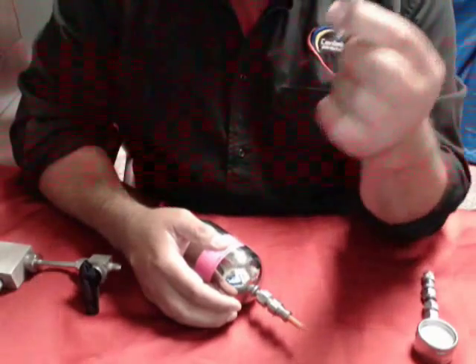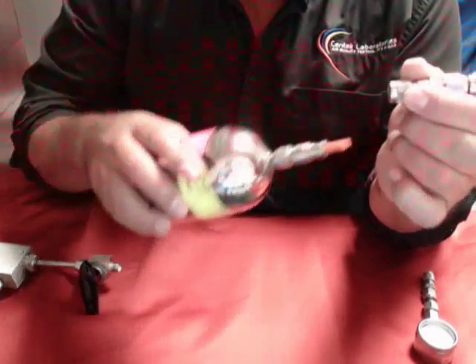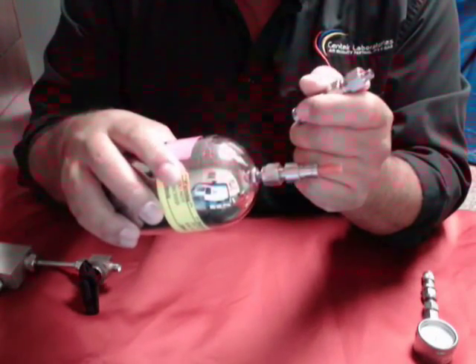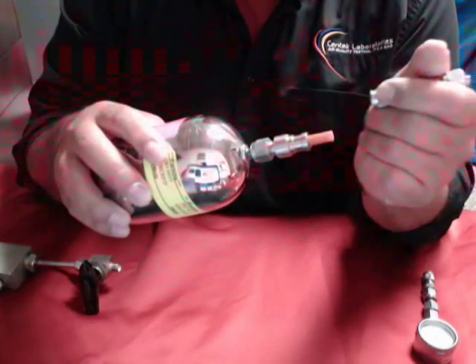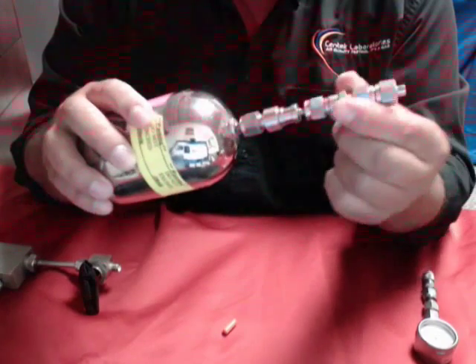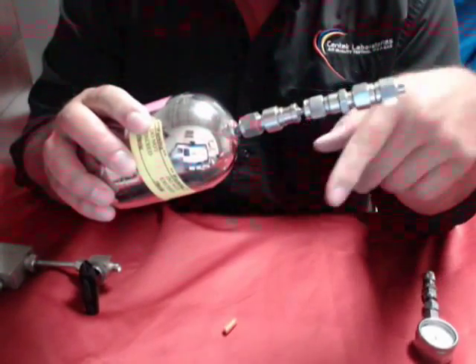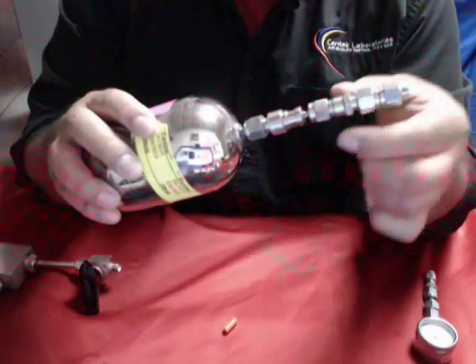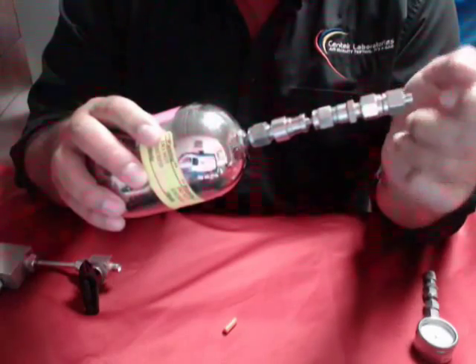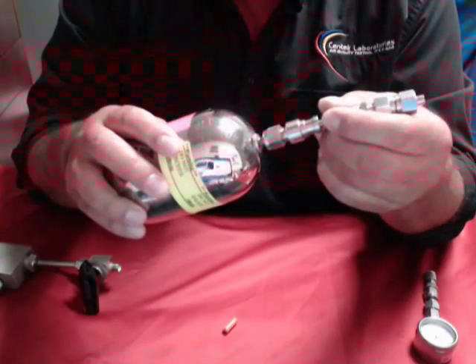The other thing you'll get is a quick grab. When this is hooked up to the canister, the sample will instantaneously be pulled into the vacuum. A lot of people will have this in their hands, take it off, connect it to the canister, and they've now pulled in air — which means your O2 levels are going to be wrong. If you just click it on, let it sit for one or two seconds, and take it off, and you fill the can up by about 20%, your numbers are going to be 20% wrong.